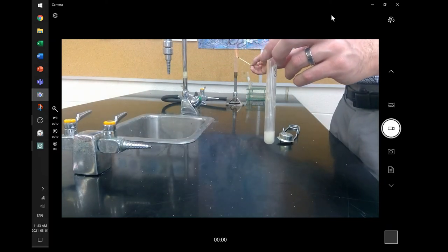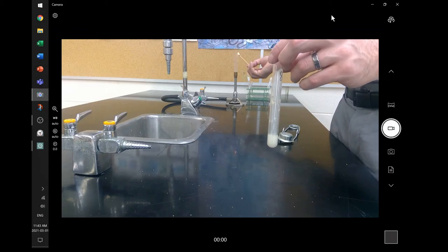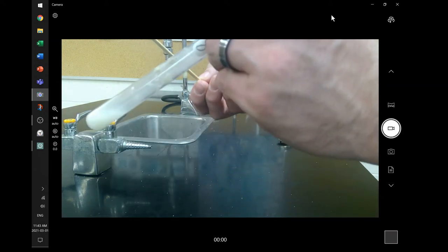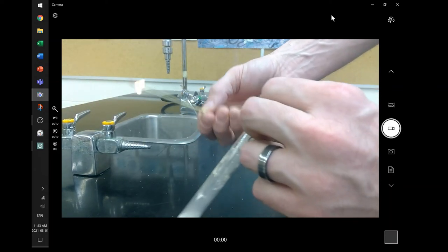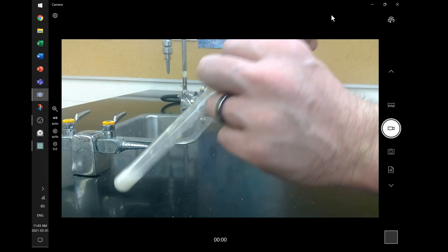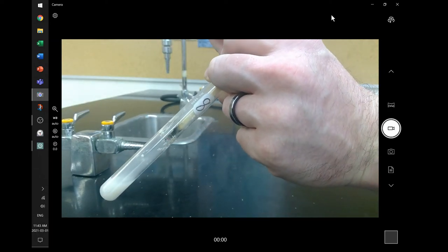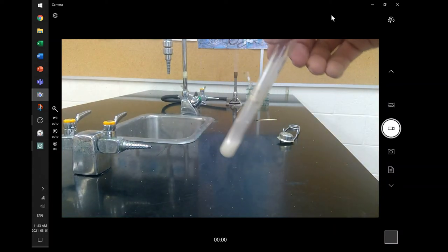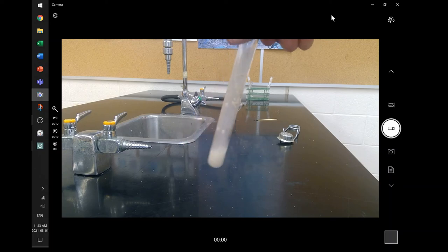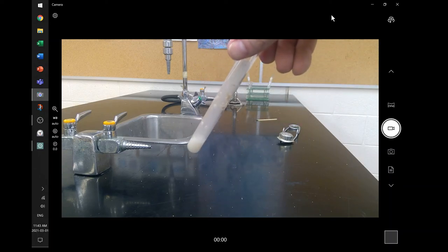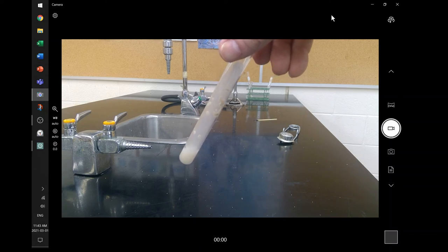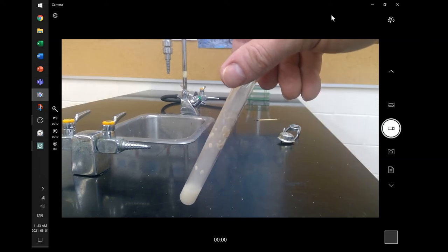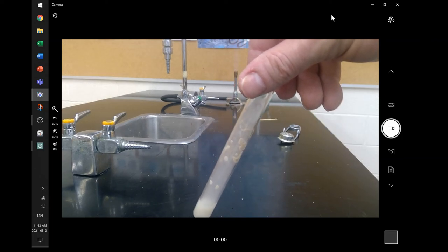And then I can do the other test as well. I want to do the flaming splint test. I want the burning splint test. I want to test that fire. Does this gas react with the presence of a fire? The fire itself. So let's try that. And no. It just sort of extinguishes the flame and puts it out. So that one's a little bit tougher to see. And it's ultimately because I think the yeast isn't the best reagent. But it's the safest one that they let us use. And on the one hand, you bring in the orange ember and you get hopefully a reemerge of that flame. A nice glow. But the other case, not so much joy.